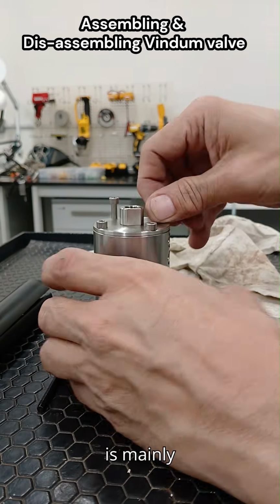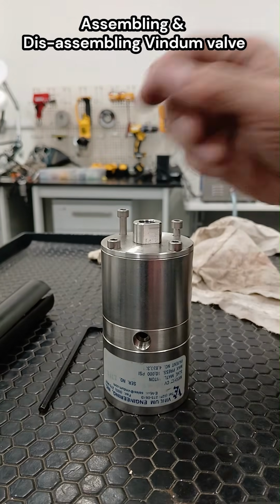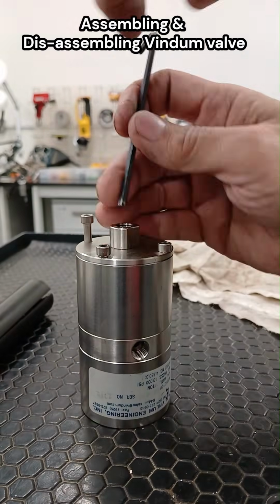Repairing the Vindum valve is mainly about disassembly, cleaning, seal replacement, and reassembly while maintaining its precision tolerances. These valves are high accuracy, high pressure lab components, so the repair process is more like instrument servicing than fixing a standard plumbing valve.